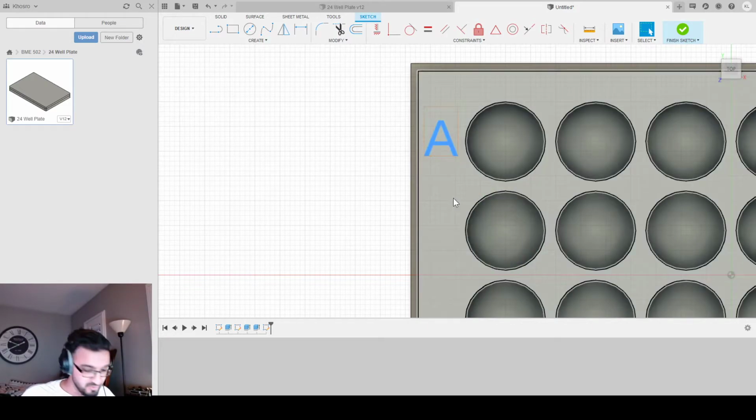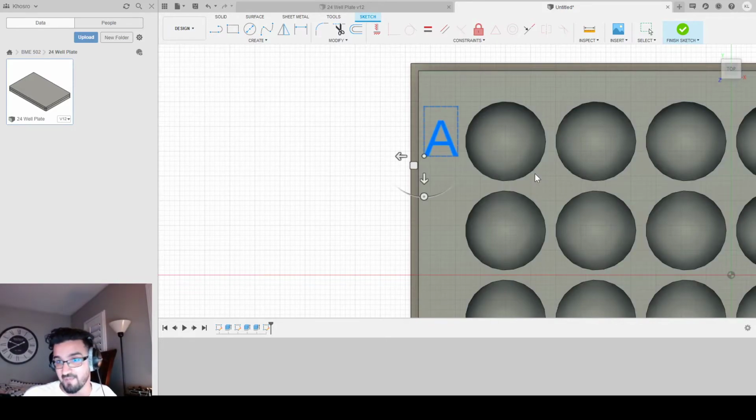I'm going to select it so it's blue, and I'm going to literally hit Control C and Control V, copy paste, and grab this arrow and drag down to where it's about the center point of the next circle. It doesn't have to be exact. If you care, you could do the math, and the distance is 18. So if you just go 18 millimeters down, you should be around the center point somewhere.